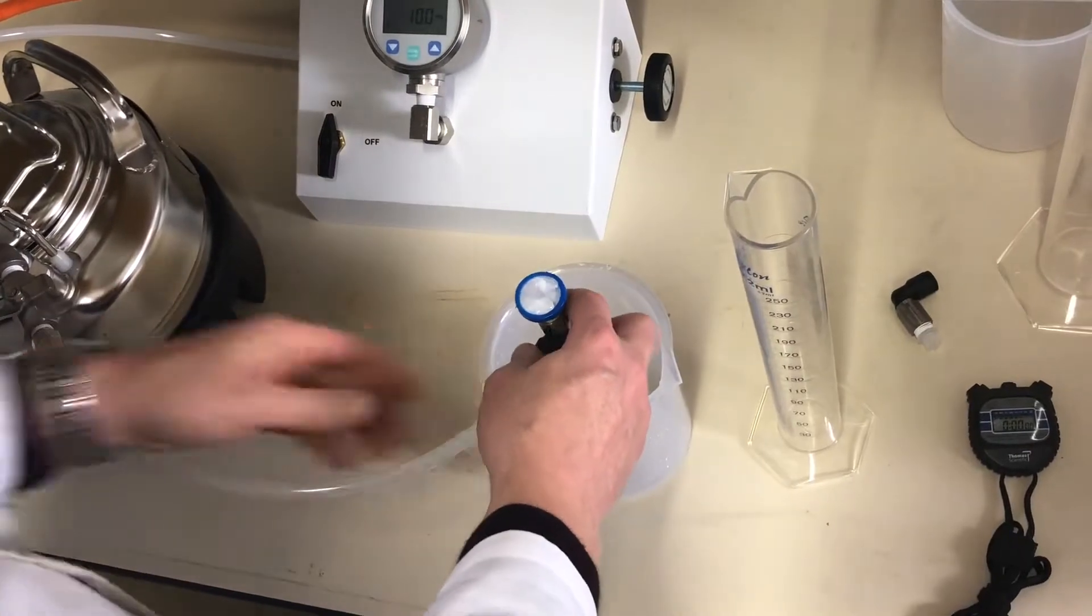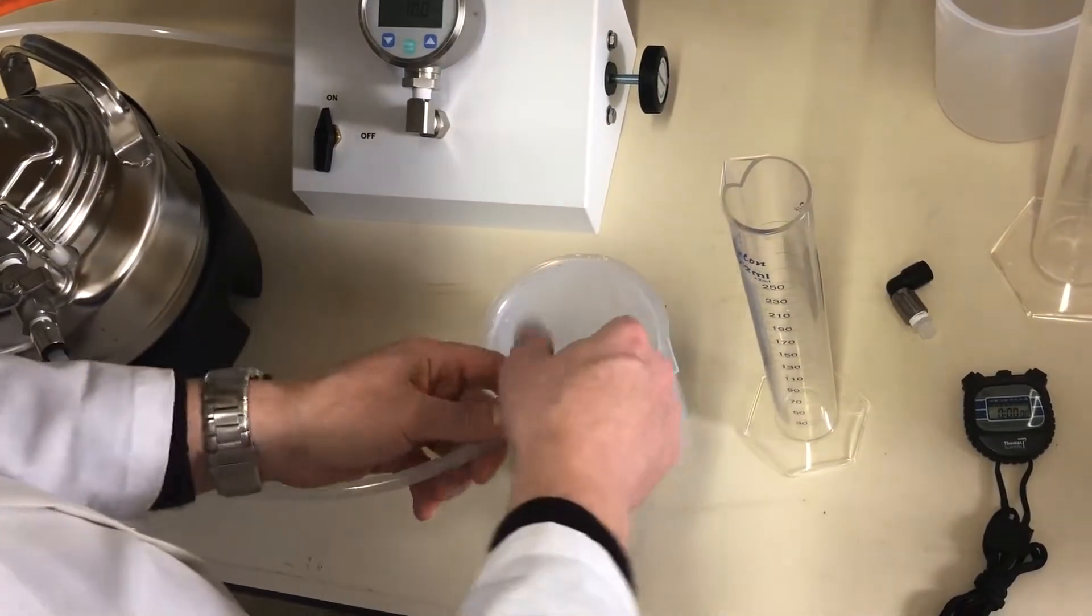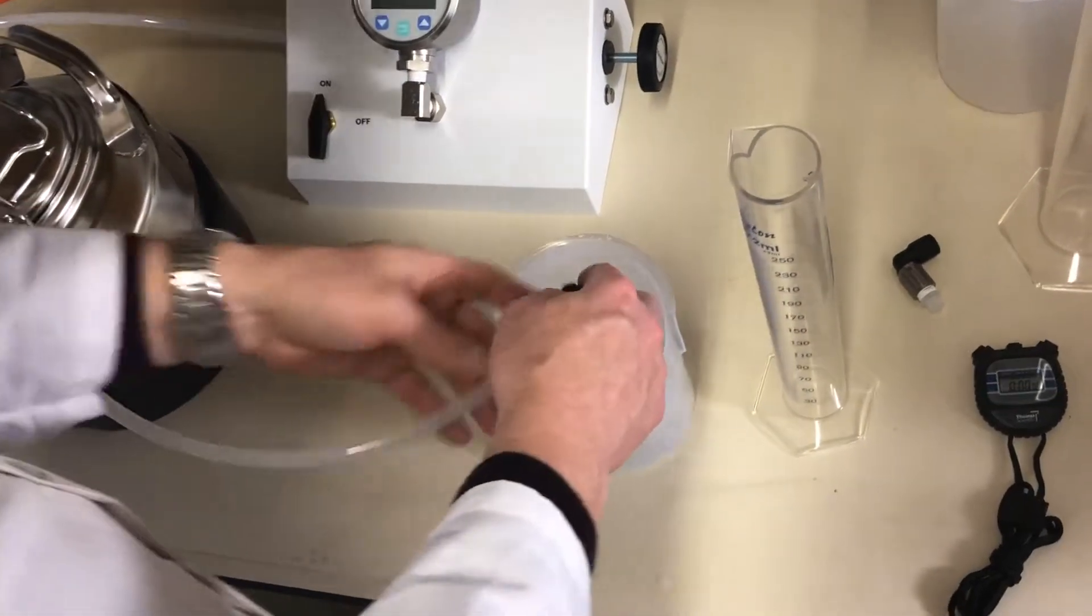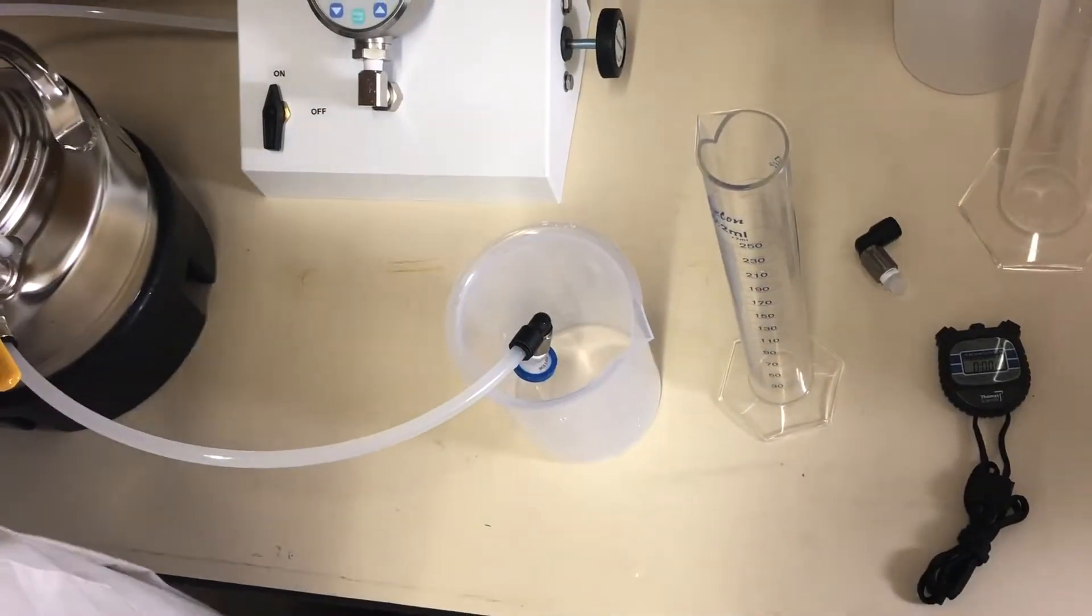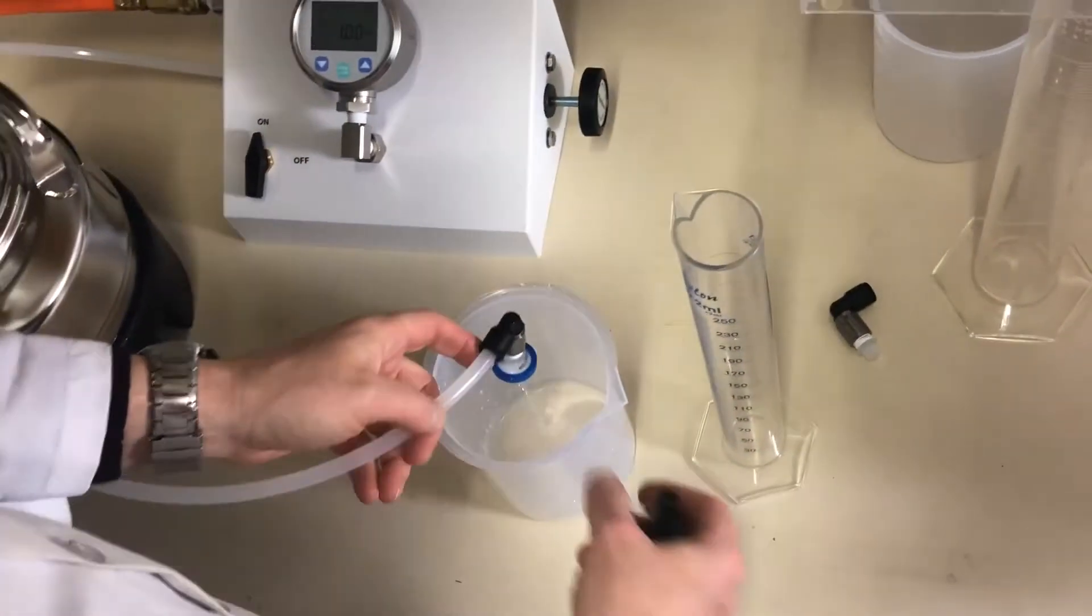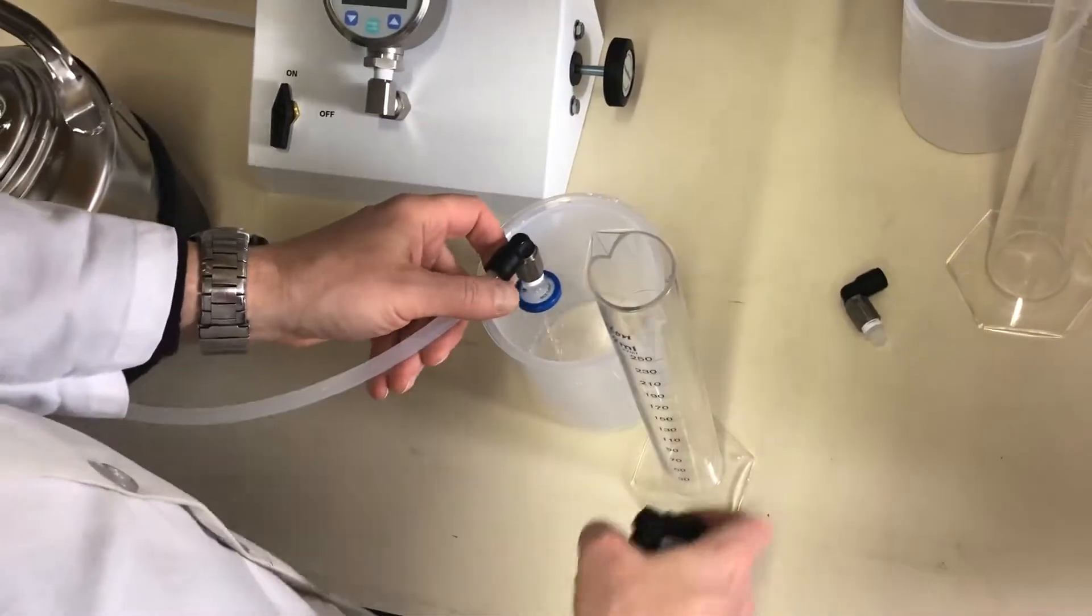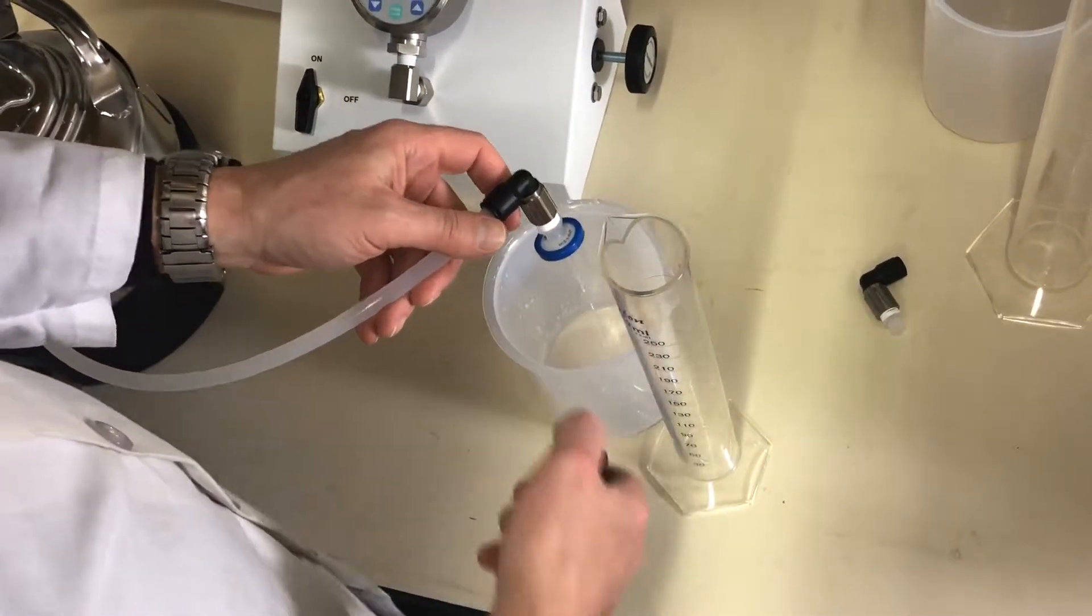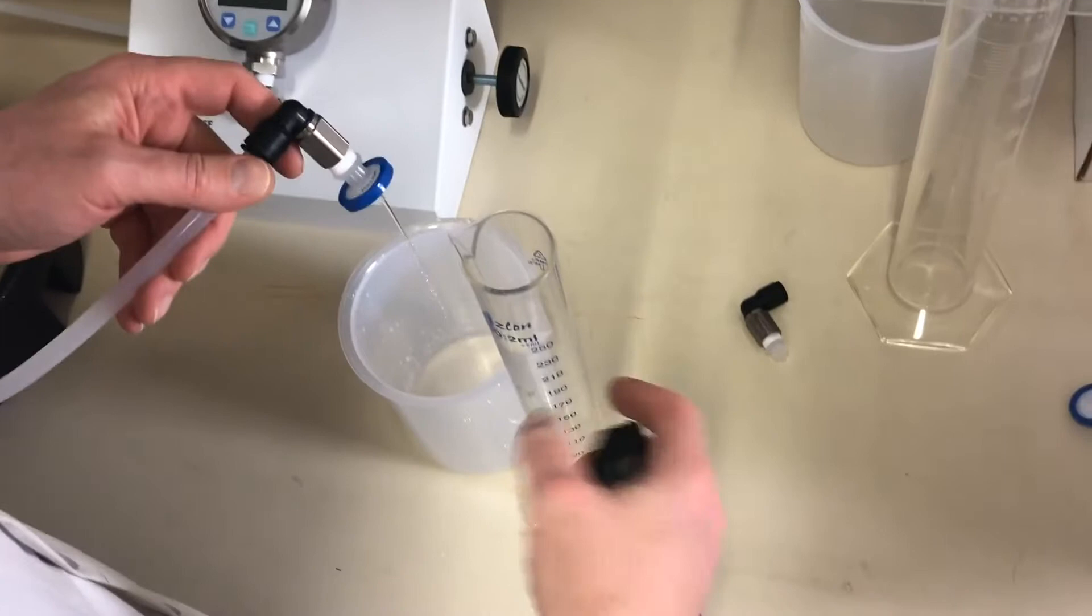See, now we've got flow. Once the flow is established, you get your trusty stopwatch, and then measure the flow for one minute exactly.